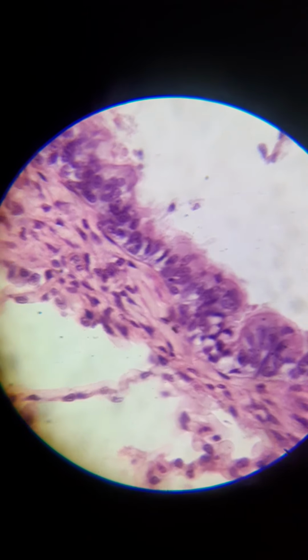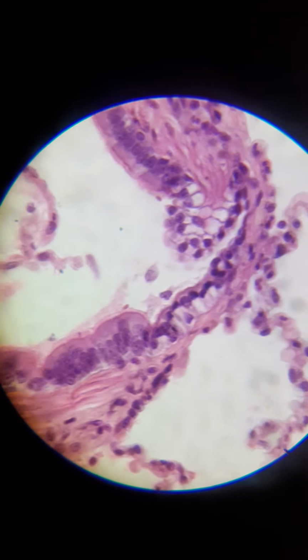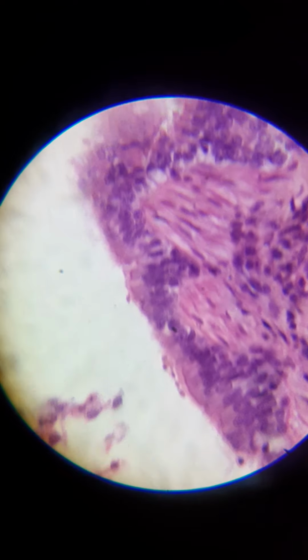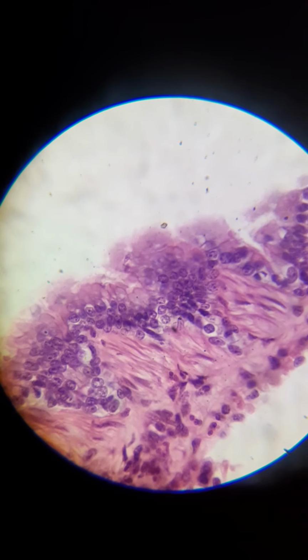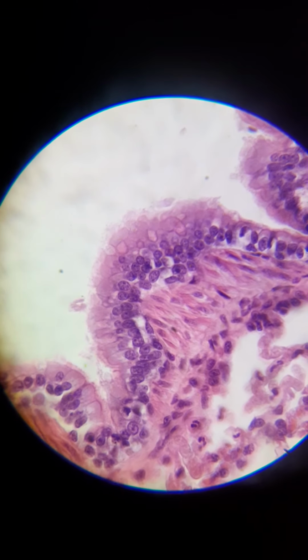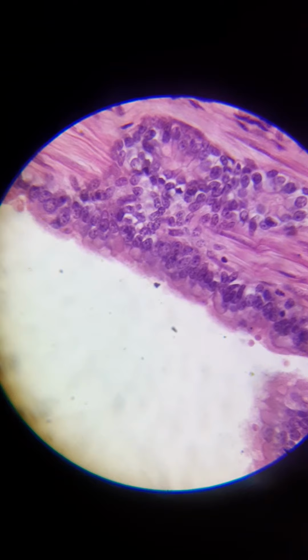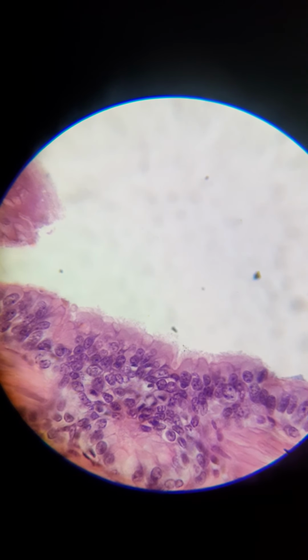So these things are stained, by the way, so it brings out certain things more than others. I'm trying to get a good image of what's called a goblet cell, but I don't think that this particular stain is really meant for that because I'm not really seeing one. But they're on the edges along with all of these columnar ciliated epithelial cells, and they're actually what secrete the mucus. So the mucus that you cough up, that's actually where it's coming from. It's from goblet cells along the edge here. I wish I could find a good example, but I'm just not seeing one. I'm wondering if the stain for this just isn't good for it.